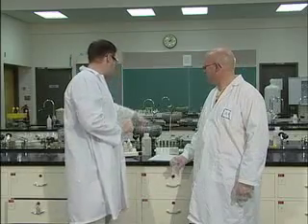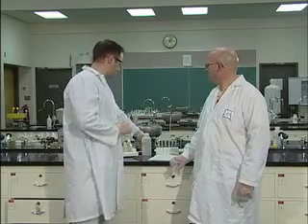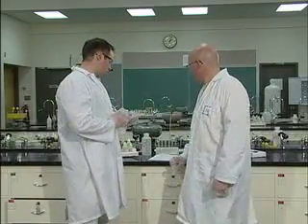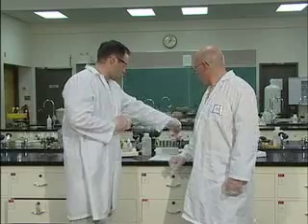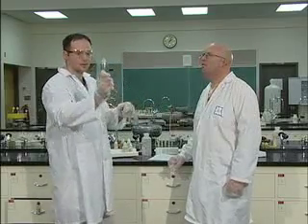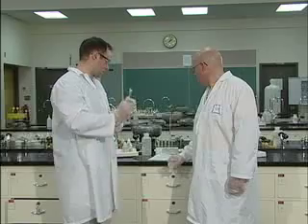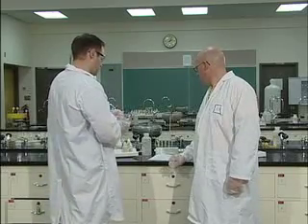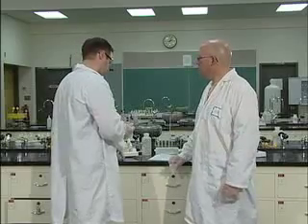Again, with the magnesium, make sure you're holding it away from your face. It gets really warm. Don't hold it by the bottom of the test tube, it will actually burn you. It's quite warm, so just be careful with it. Now, this one here, we've already pre-labeled again. This is C2 as an example. Into C2 we're going to put 30 drops of aluminum nitrate.